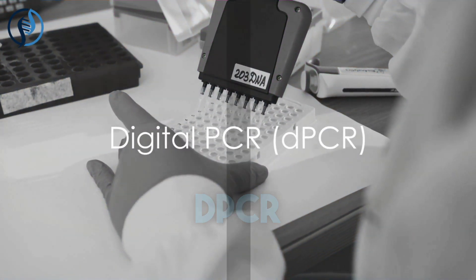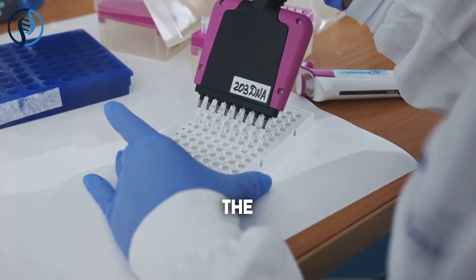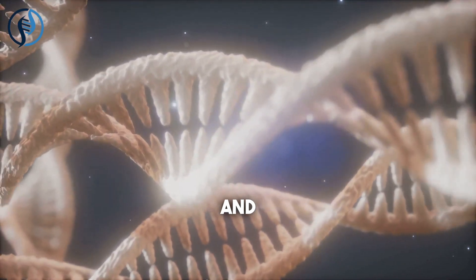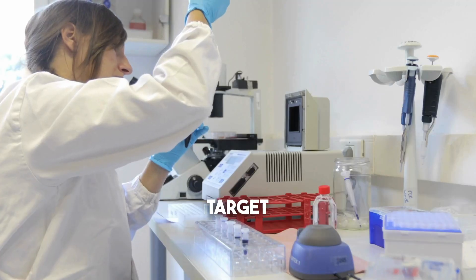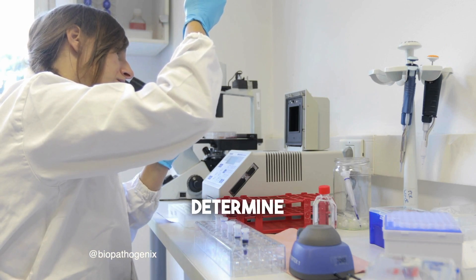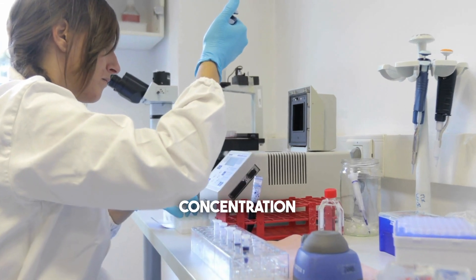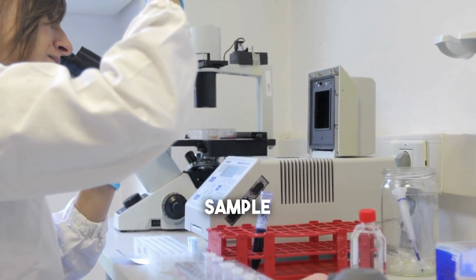Digital PCR, or dPCR, takes a different approach by dividing the sample into numerous partitions. Each partition contains a portion of the sample and can potentially contain zero or one copy of the target nucleic acid. After amplification, the partitions are analysed to determine the number of positive partitions, which is then used to calculate the absolute concentration of the target nucleic acid in the original sample.